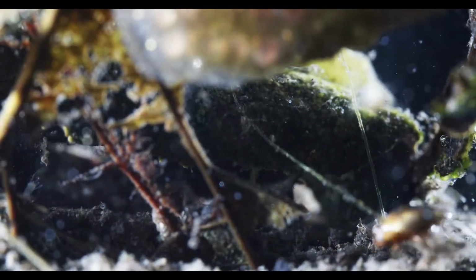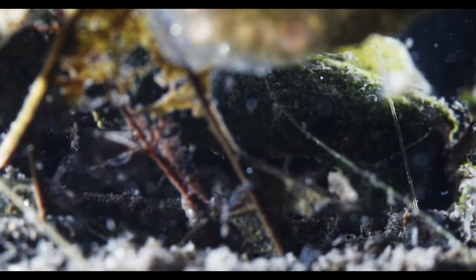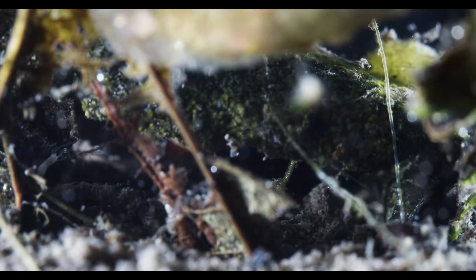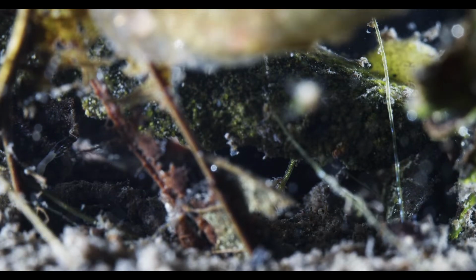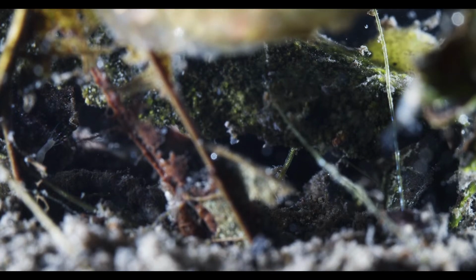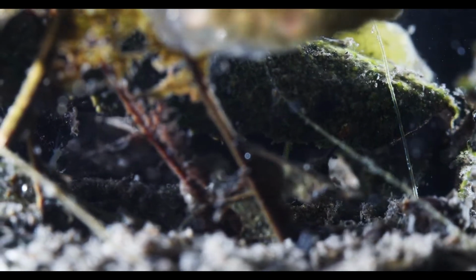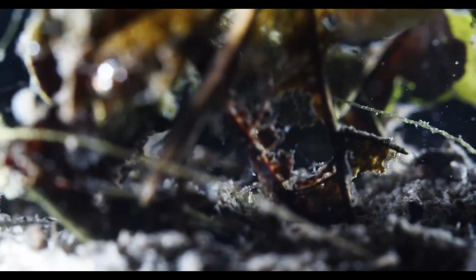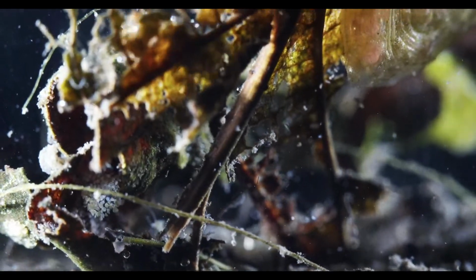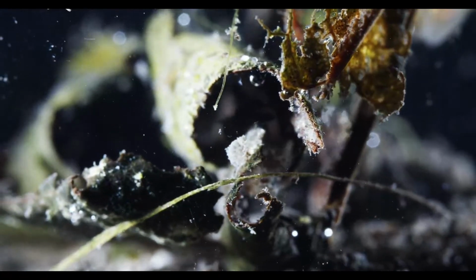Yeah, that's a Hydra. See on the left edge of the screen there? In the dark, there's a Hydra hiding. Looks like it has some tentacles, some damaged tentacles. Tiny little Hydra. The bug! Oh no, he's behind the leaf. Yeah, he's too fast. He's actually too fast.